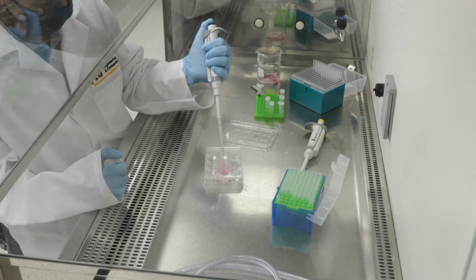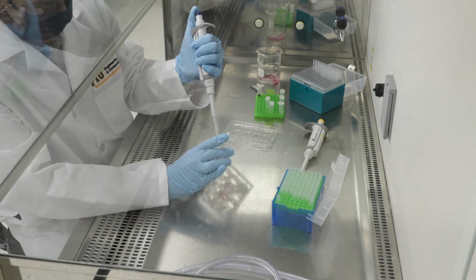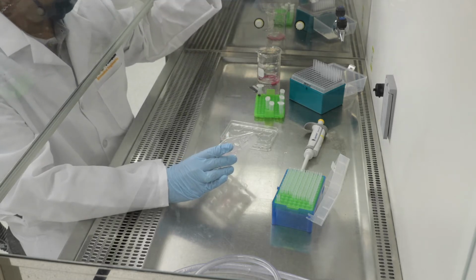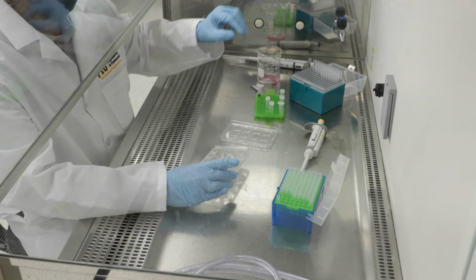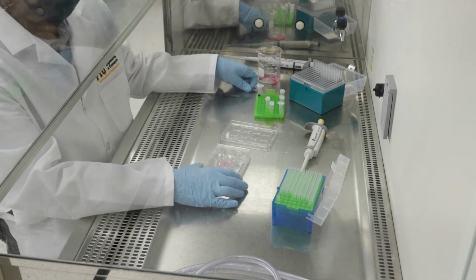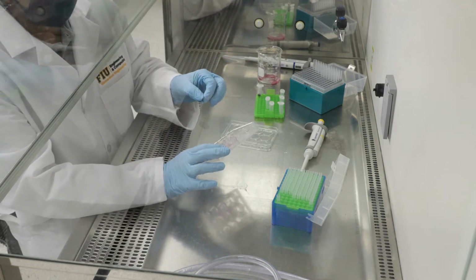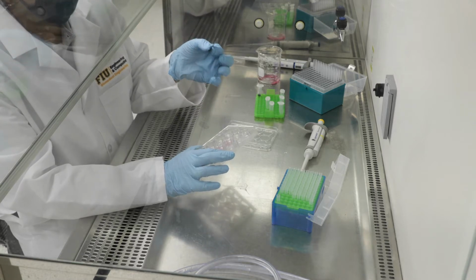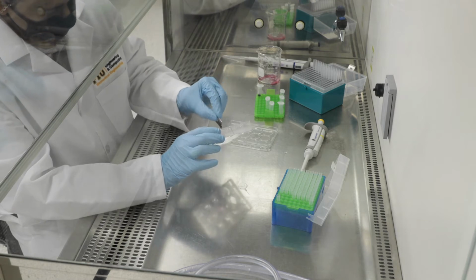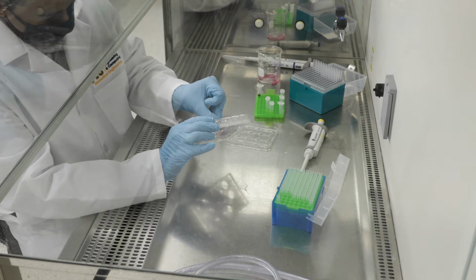Also, keep in mind that these are gel constructs, and so the gel is still pretty firmly stuck at the bottom of the well plate. So the next step would, of course, then be to try to remove the gels from this well plate environment. To assist with that, I'm going to use the edge of a razor blade to gently lift the gel or the cellular gel constructs up from the bottom of the plate, as you can see I'm doing right here.